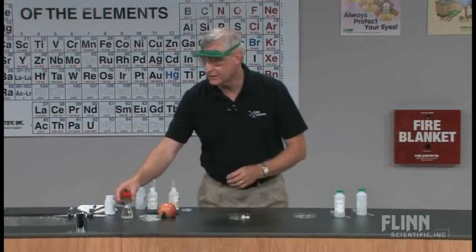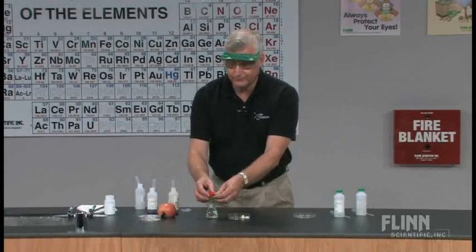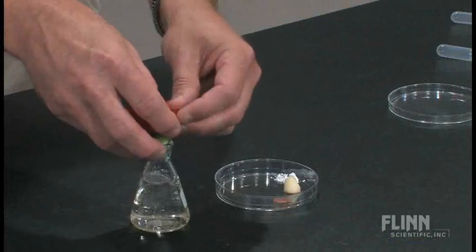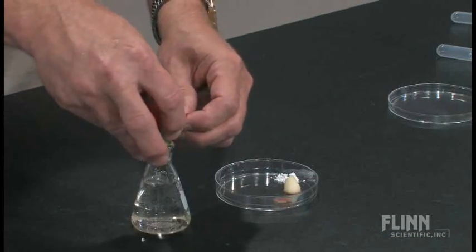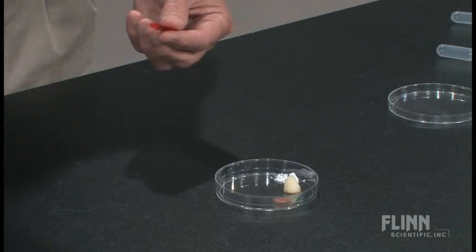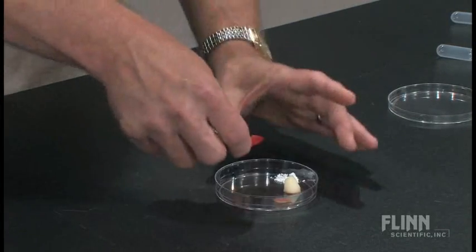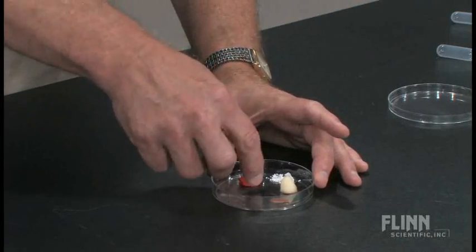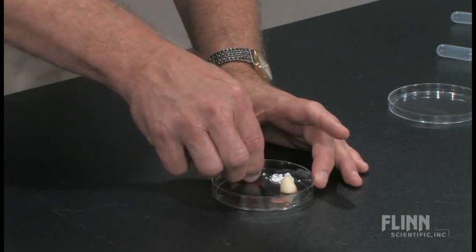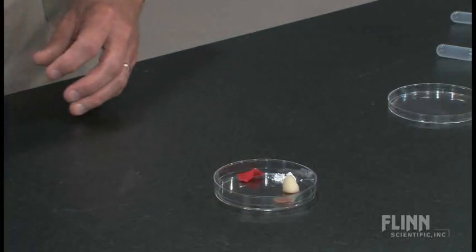We're going to take a small piece of a red flower and we'll place the flower in there to represent living matter that we might have around. I'm using a carnation today. I found that red colors work quite well with this process — like a rose or any other type of petal works fairly well as well.